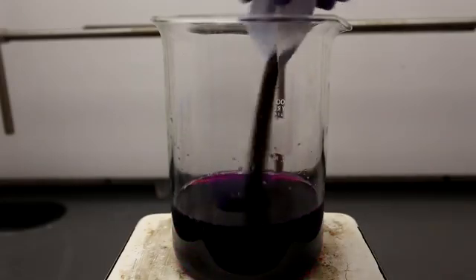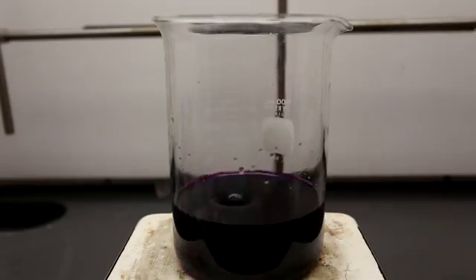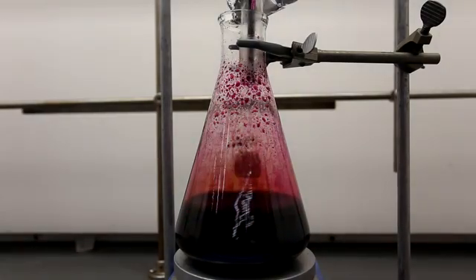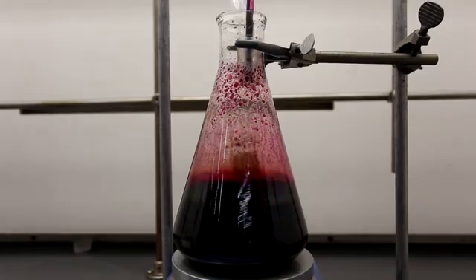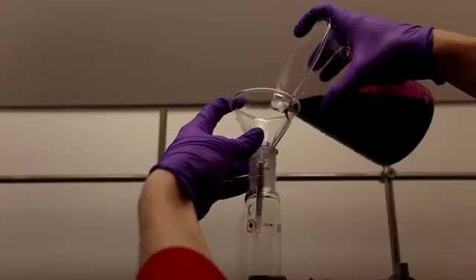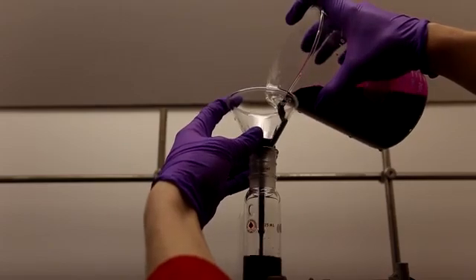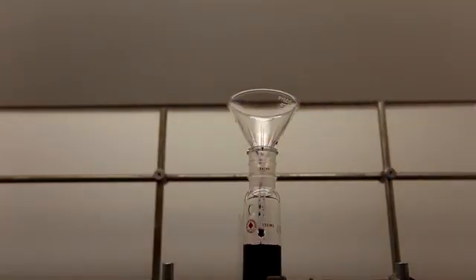Butyric acid is a foul-smelling carboxylic acid. Butyric acid is responsible for the smell of rancid butter and is the main contributor of the smell of vomit. The most efficient method of production of butyric acid is by fermentation, but I've chosen to explore some chemical methods.